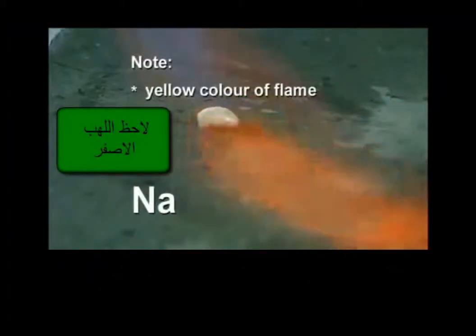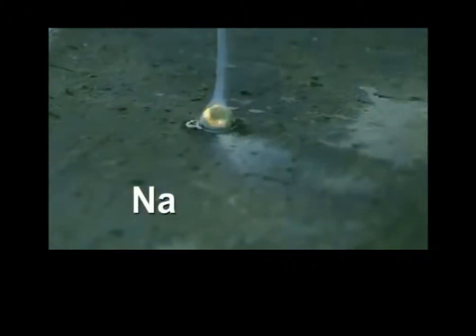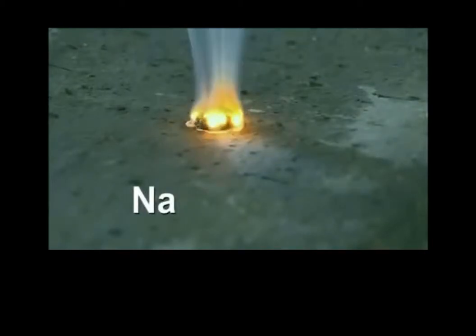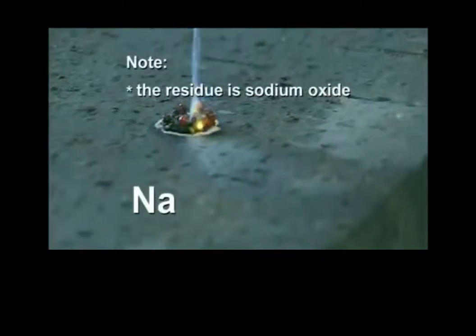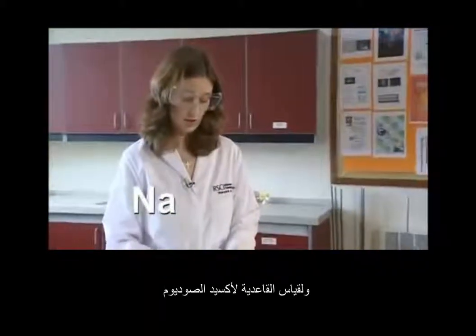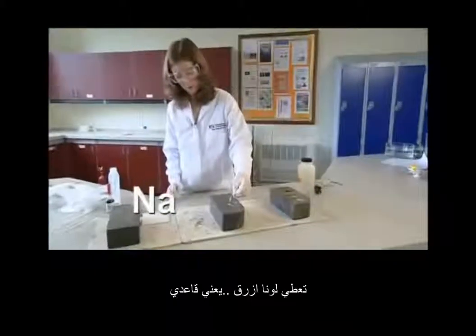Again with a roaring Bunsen flame. You see it melting and reacting with the air. You can again test the residue of sodium oxide with some moist indicator paper.